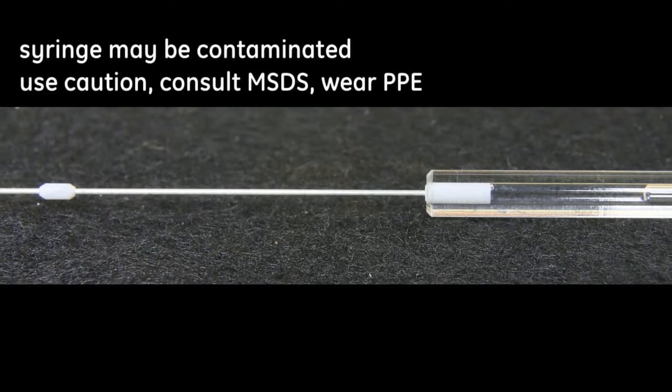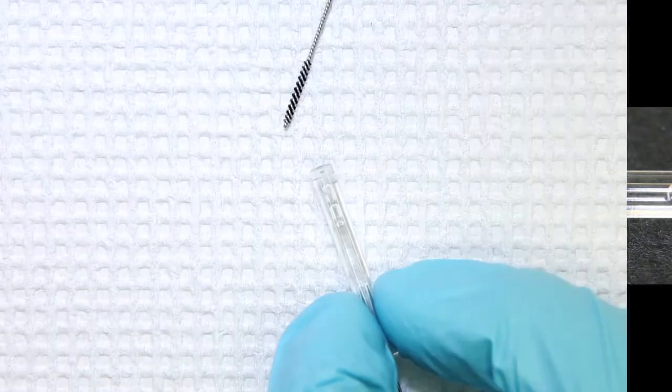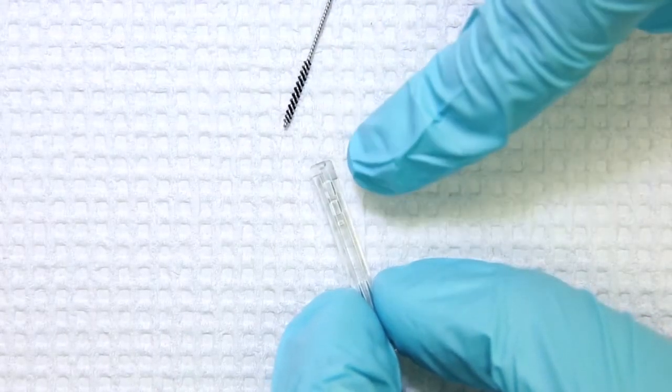It's good practice to occasionally inspect your titrant syringe for any damage, especially near the fill port.